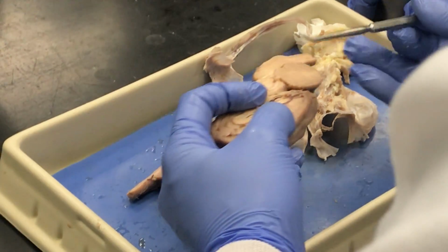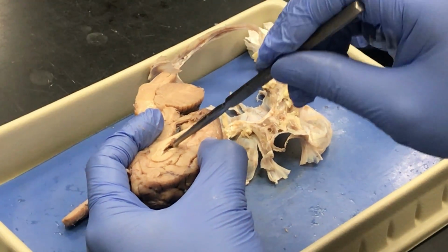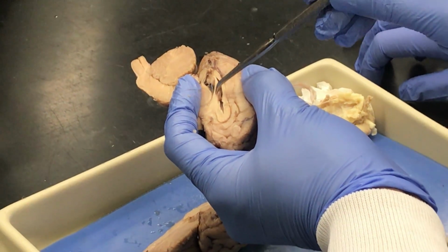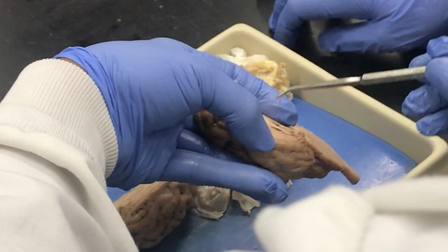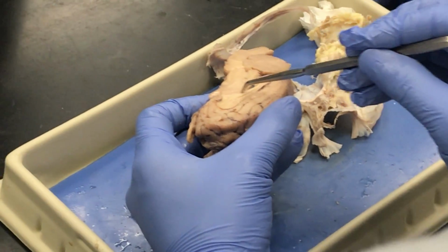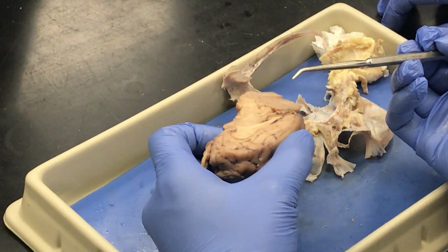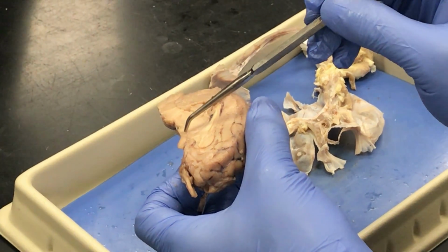The fornix. Starting at the corpus callosum into the lateral ventricle, and that inferior border, you're looking for the white matter. This is the fornix. The bottom part: corpus callosum, lateral ventricle, and then fornix. We already did thalamus, but the thalamus, interthalamic adhesion, that's another skip. So we just got a thalamus, the circular area. Then the hypothalamus, slightly anterior and inferior to thalamus.